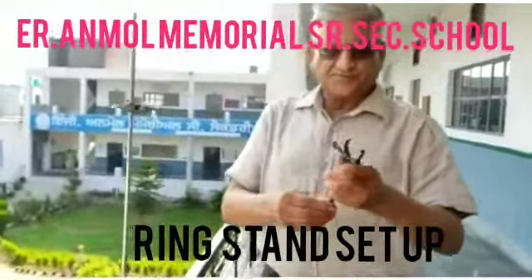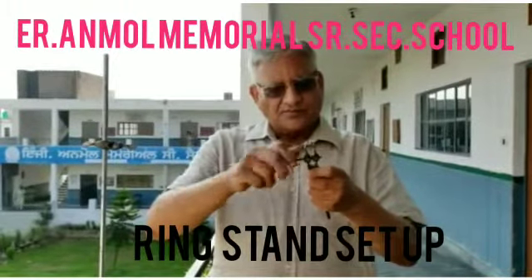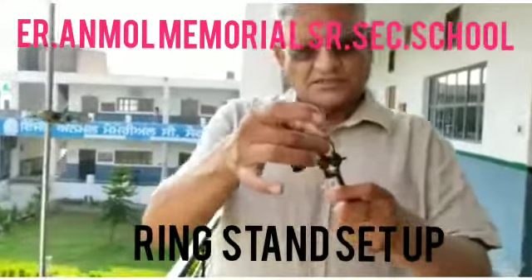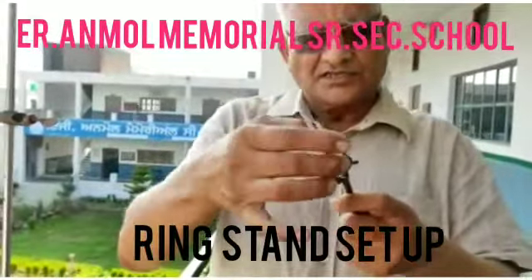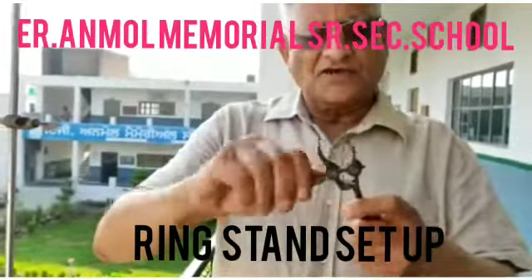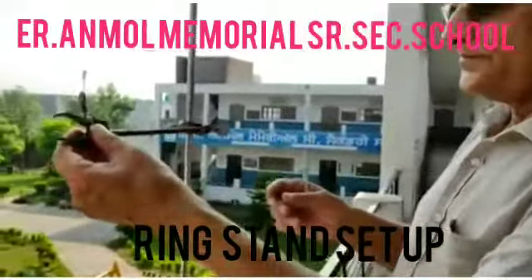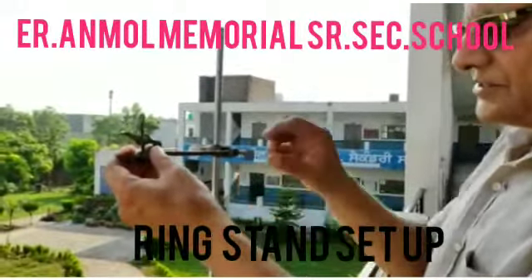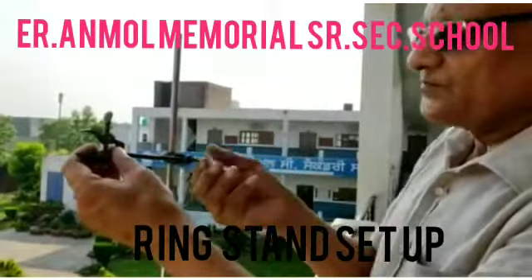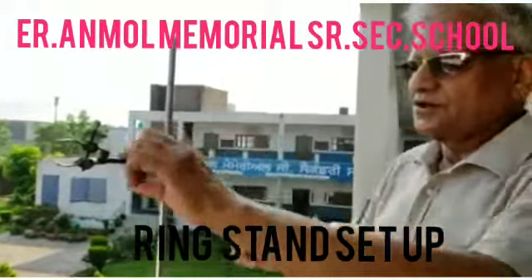There is one more instrument here. There is also a screw here. By revolving the screw clockwise, the space is reduced. And when you open it anti-clockwise, the space is more. It is also adjusted on the other side. Now you can turn the other screw clockwise and now it is tight.